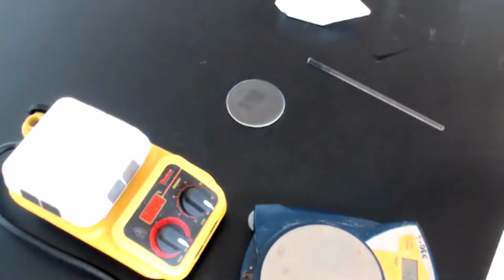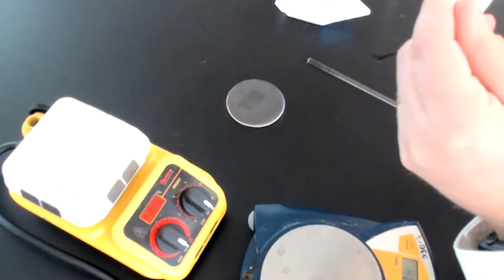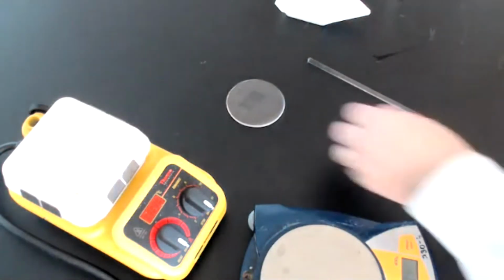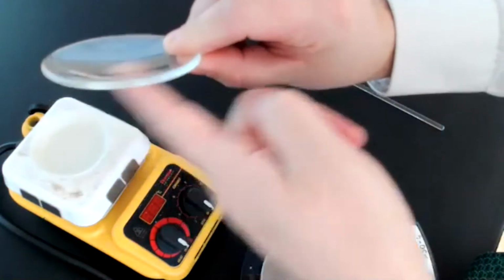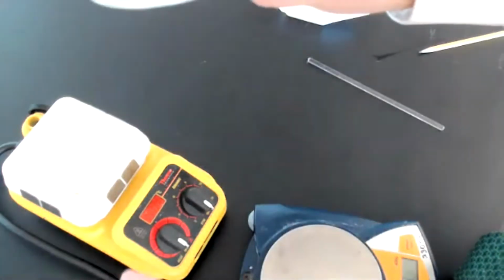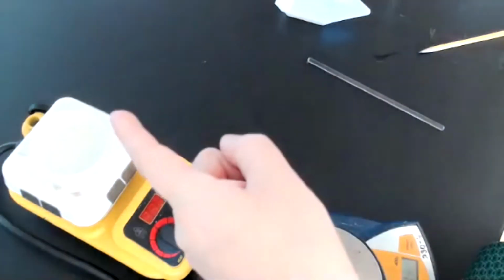So in step number 4, it says place the evaporating dish on the hot plate, place the watch glass concave side up so that there is room for steam to escape. So we want the watch glass to be placed on it like this, concave side up. So the rounded part is actually going to sit down into the evaporating dish. And what will happen is as the water evaporates, it's going to condense on this watch glass. It's going to run into the center and fall back down.